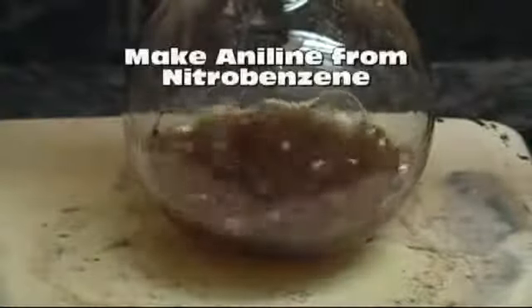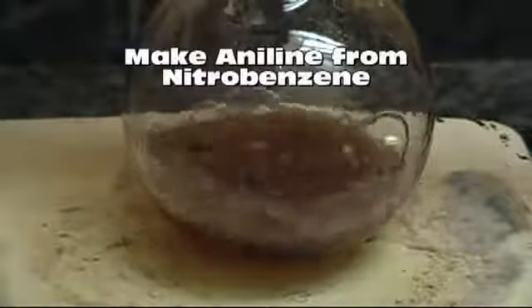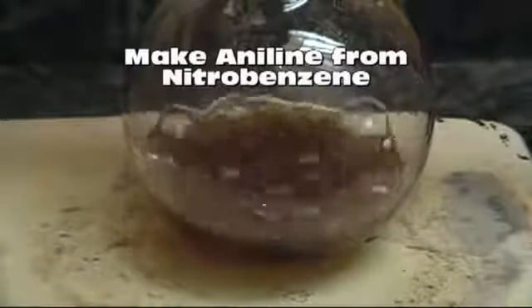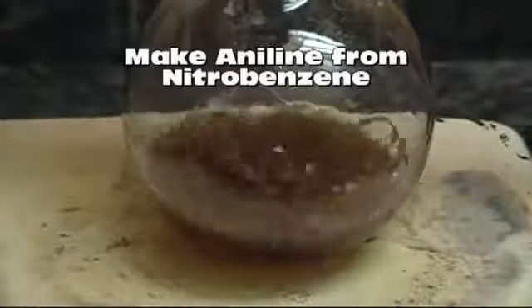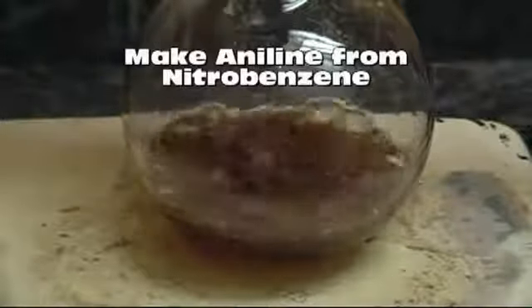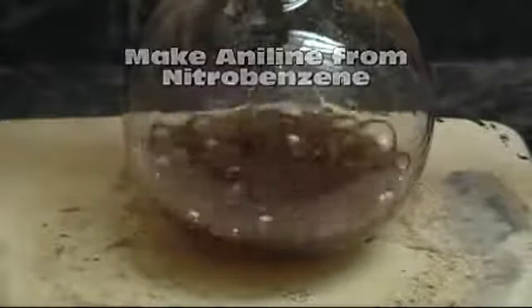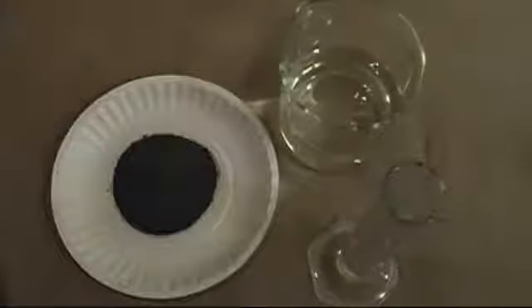Hello everyone. In a previous video we made nitrobenzene. We'll be using the nitrobenzene we made in this video to make aniline. Both nitrobenzene and aniline are suspected carcinogens, so be careful when handling.